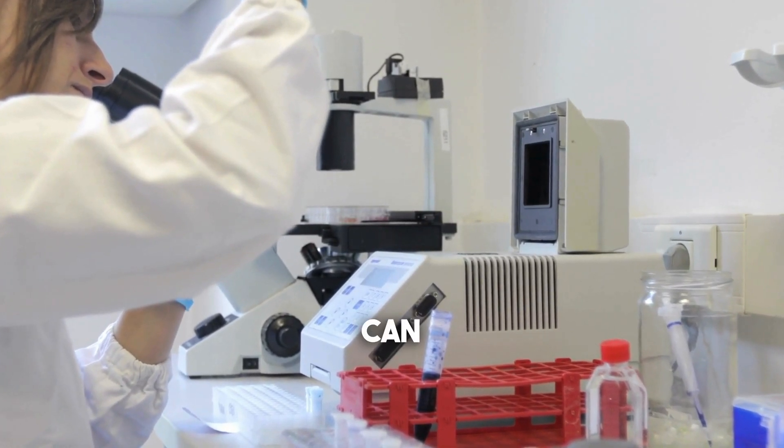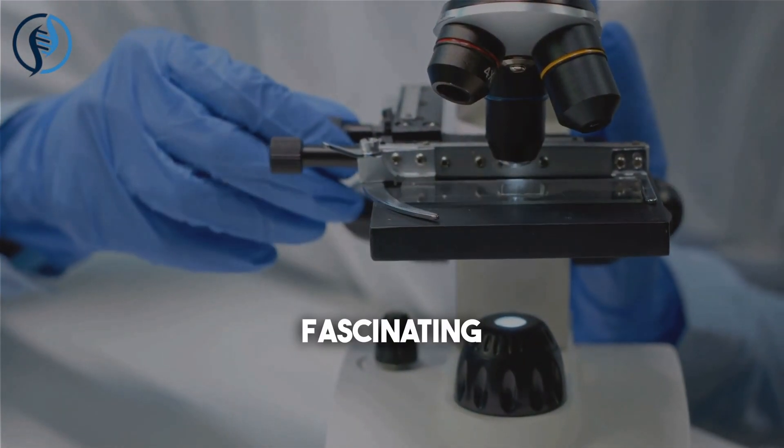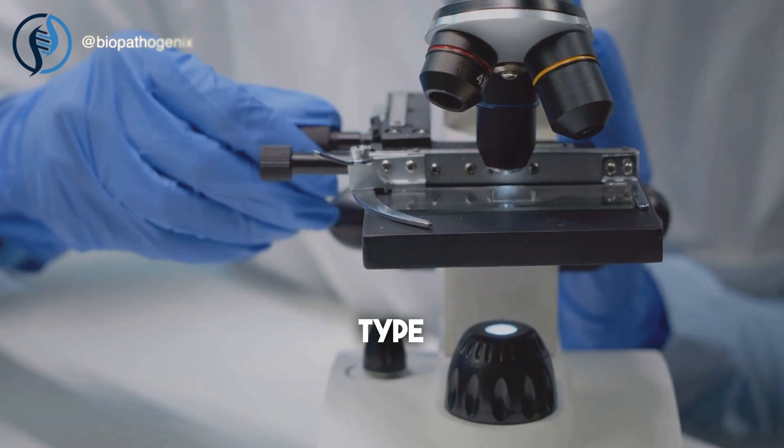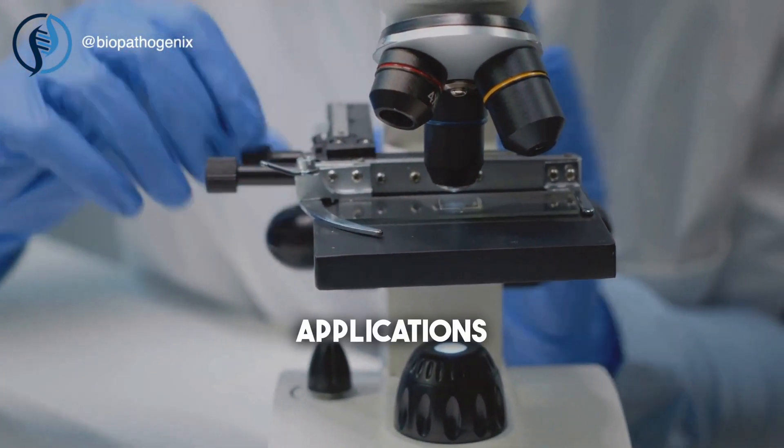As you can see, the world of PCR is a diverse and fascinating one, with each type offering unique benefits and applications.